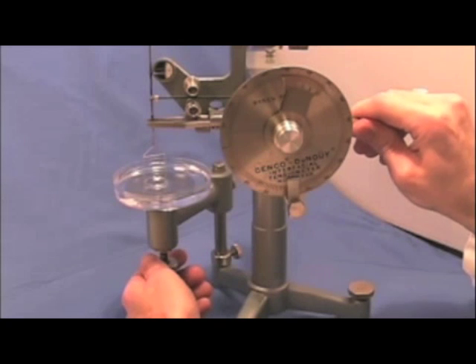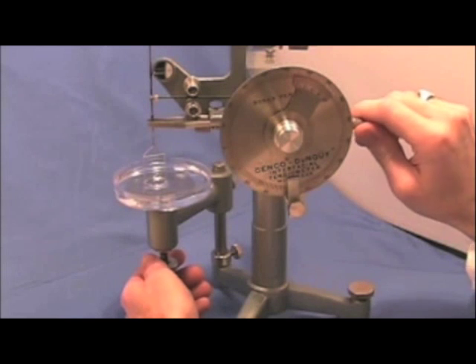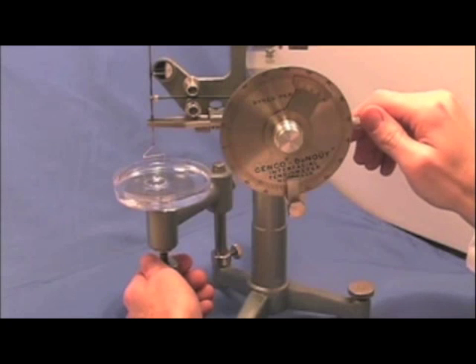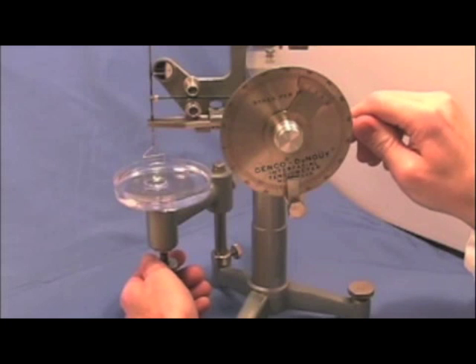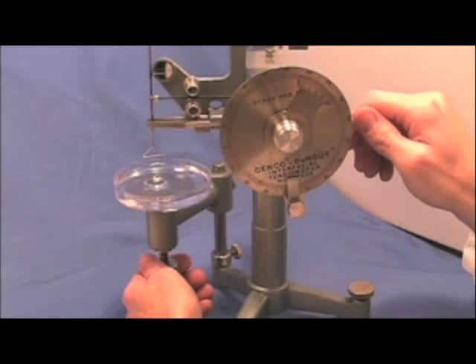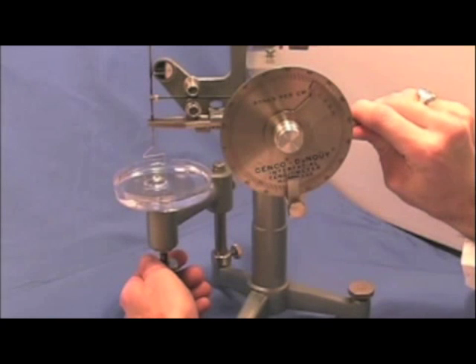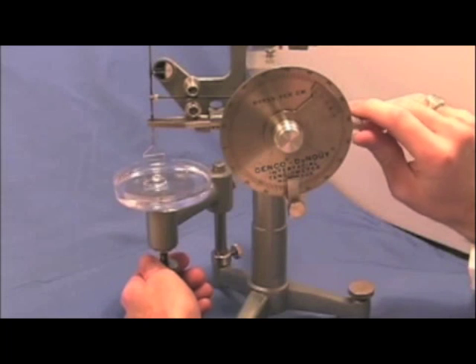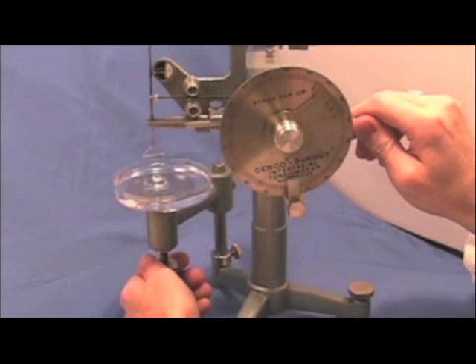Lower a little bit more, compensate with the right hand and read the gauge. Lower the table sample table, see a nice deflection on the surface of the liquid now. Lower a bit more, adjust with the right hand. Lower the table a little bit more, I'm getting very close to the breaking point.